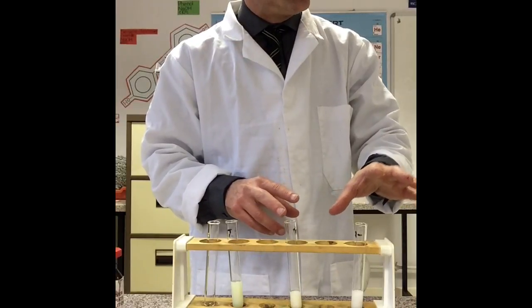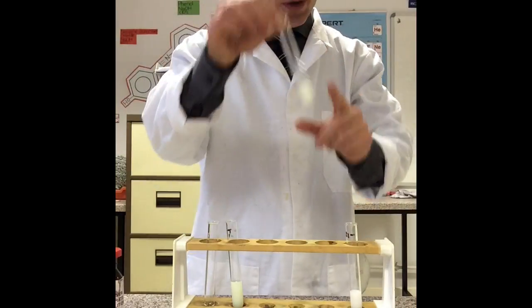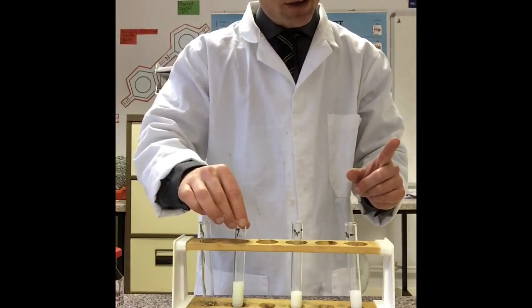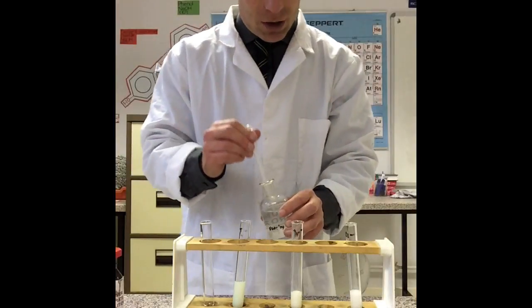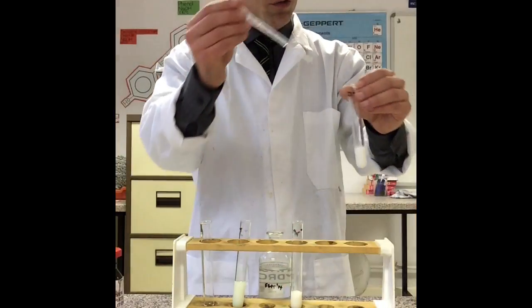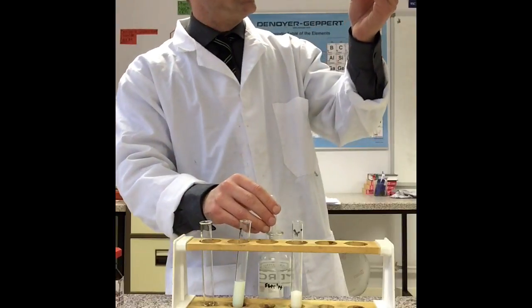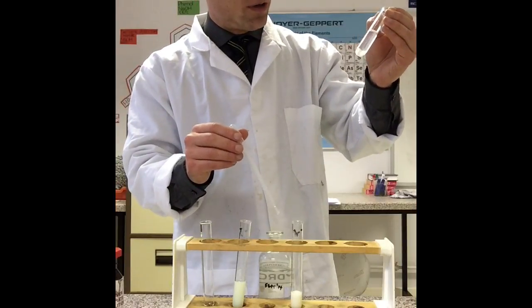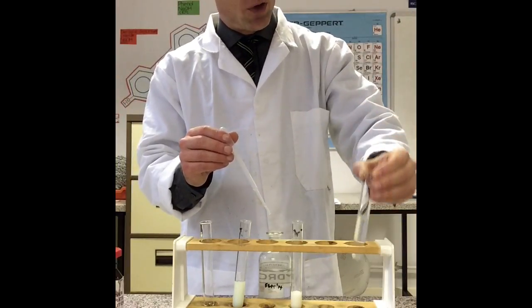What are these precipitates? What is the solid that I've made? Well, for chloride I've made silver chloride, this one is silver bromide, and this one is silver iodide. It's really important that you realise that precipitate is the silver salt. Now, the next stage was to see whether they dissolve in dilute ammonia solution. I'm going to pop in some dilute ammonia into the chloride — give it a shake. And what do you see? That has definitely dissolved. The silver chloride has dissolved.